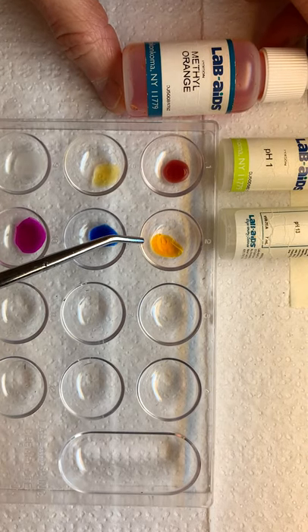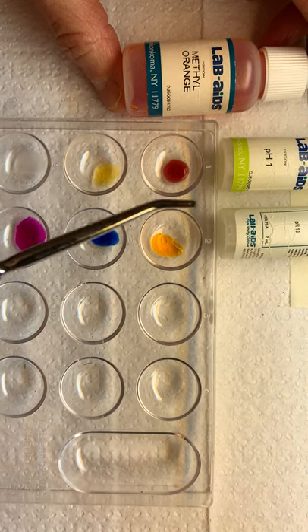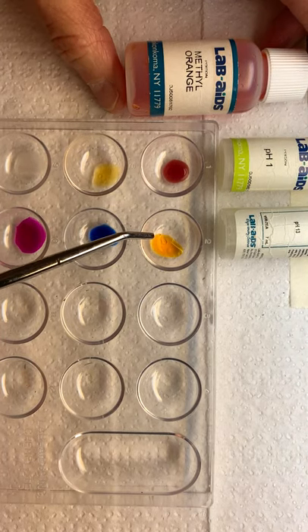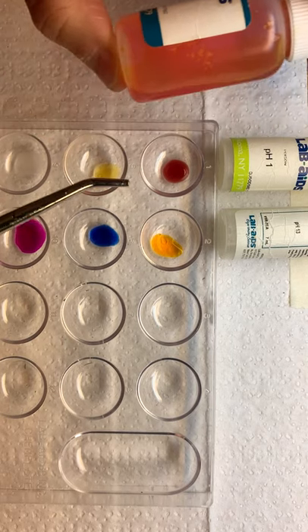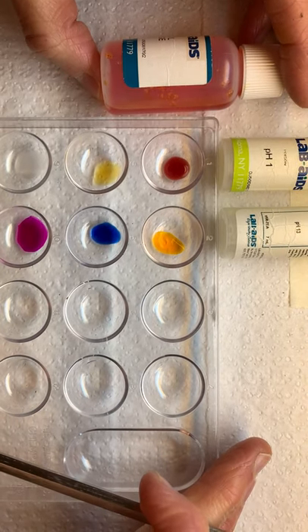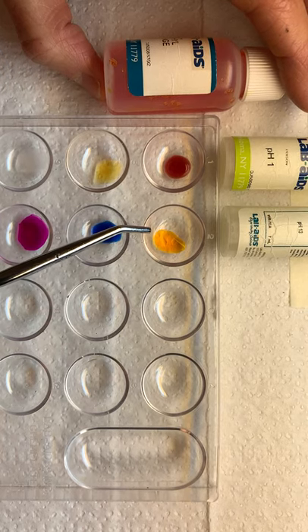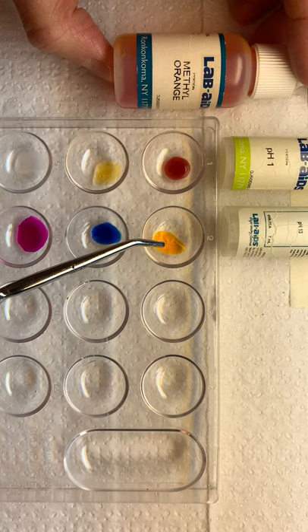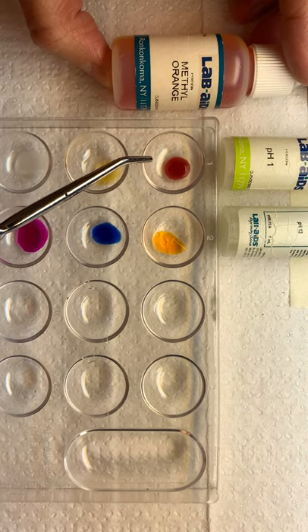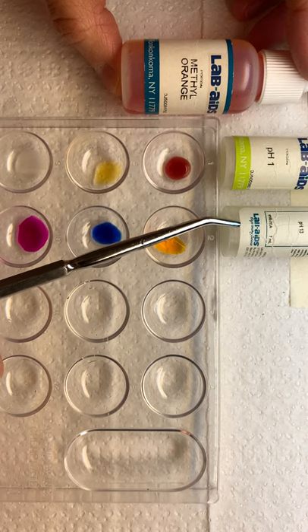What happened to methyl orange in the presence of pH 13? pH 13 — is that an acid or a base? Right, it's a base, so we're on the alkaline end now. Methyl orange, which starts out as orange, actually didn't change much — it's still orange. So methyl orange had no change in the presence of pH 13, which is a base. It did change to red in the presence of pH 1, which is an acid.